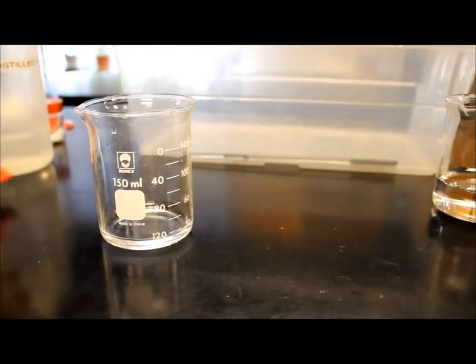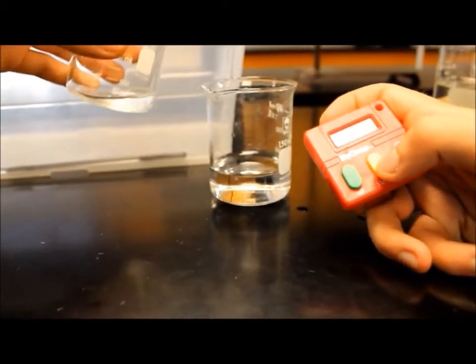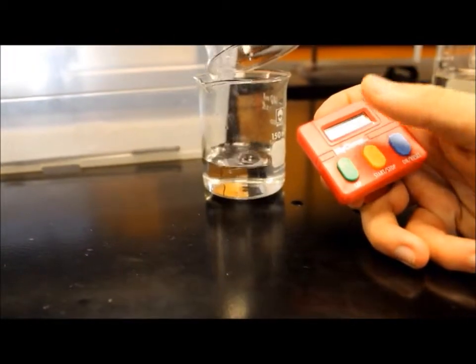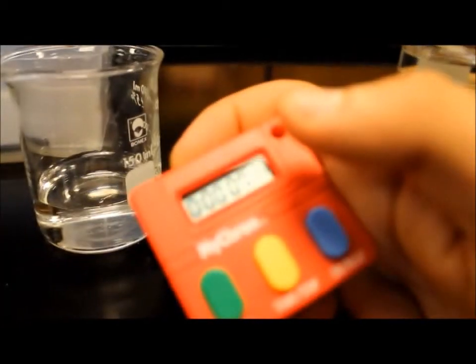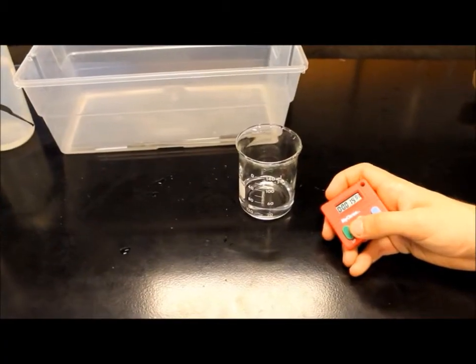Now, pour solution A into solution B and make sure someone is timing the reaction from that exact moment. Only stop when the blue-black color is even throughout the solution, and record the time to the nearest second.